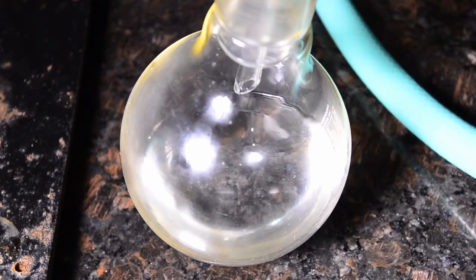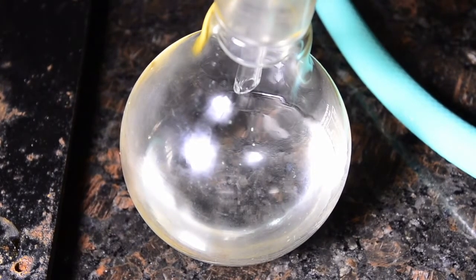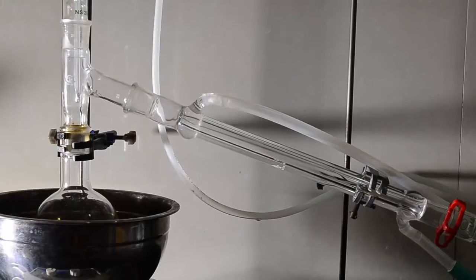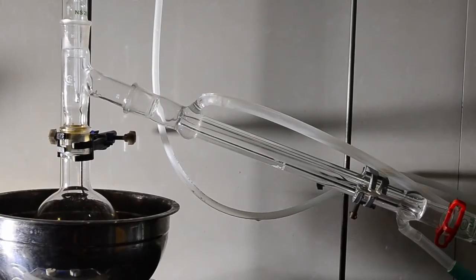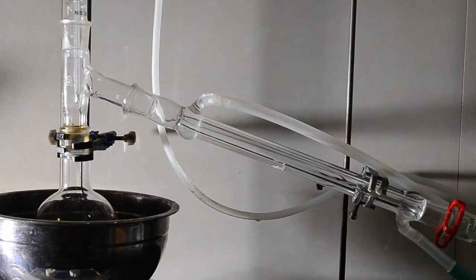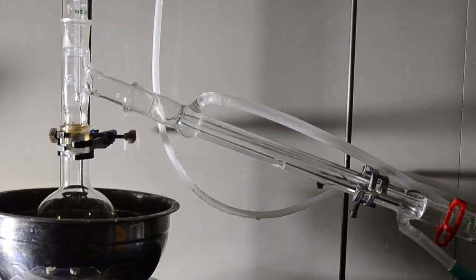Take extra care when disassembling the apparatus. We recommend removing the distillate and then cautiously adding a small amount of water into the top of the still head. This will generate some heat but will destroy any acid chloride remaining in the apparatus.